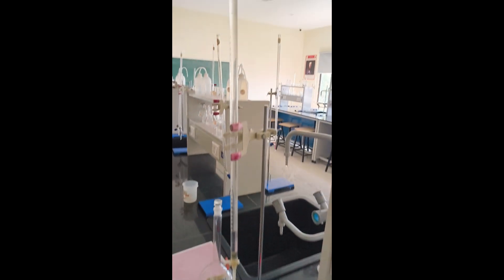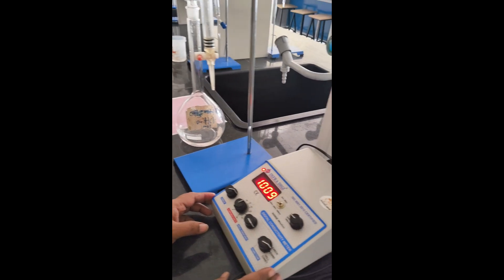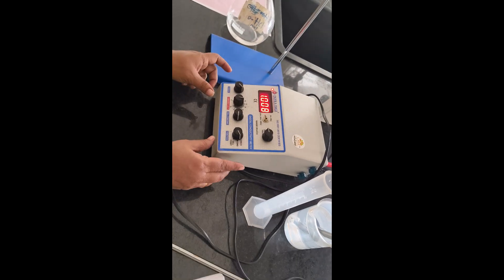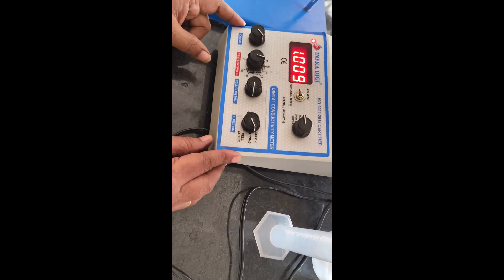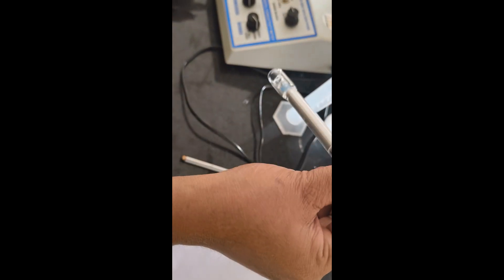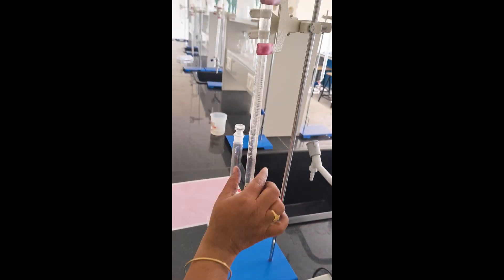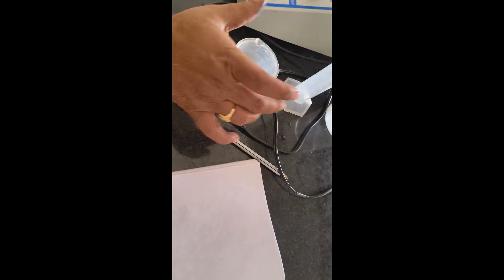Now we will discuss the second experiment: estimation of strength of HCl by using a conductivity meter. This is called a conductivity meter. By using this conductivity meter, we have to find out the conductance of the acid solution. This is called a conductivity cell. In this experiment, we require a burette, beaker, measuring cylinder, conductivity meter, and conductivity cell.